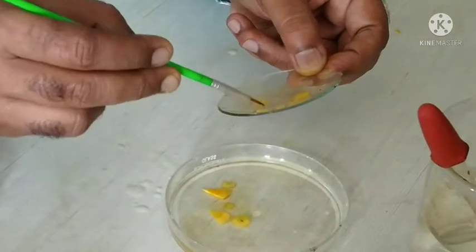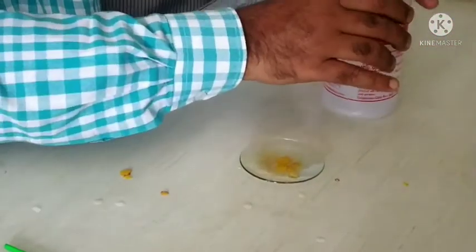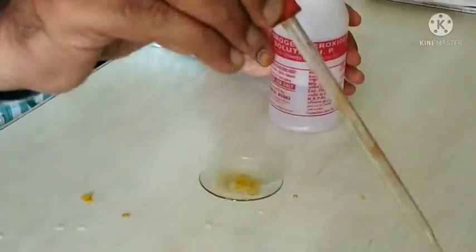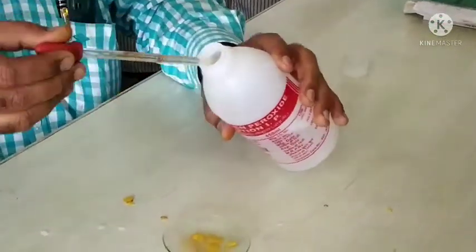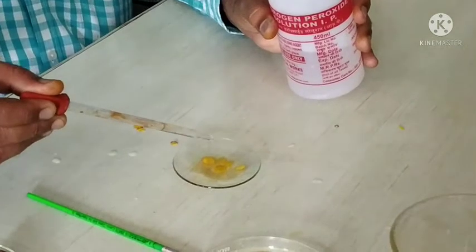After cleaning the section, bleach it using bleaching reagent, that is hydrogen peroxide. Use 4 to 5 drops of hydrogen peroxide for bleaching. When you bleach the section, it reduces the pigmentation and makes the tissue clear in appearance.